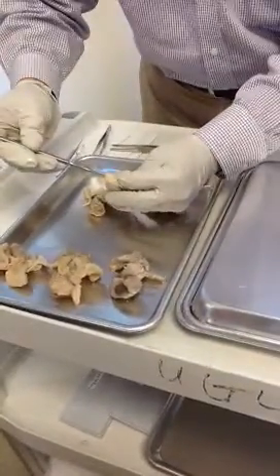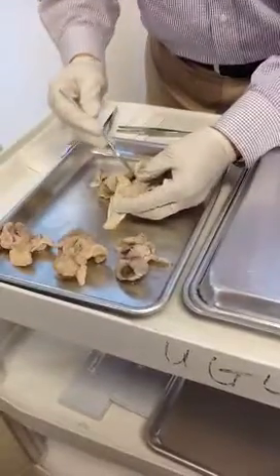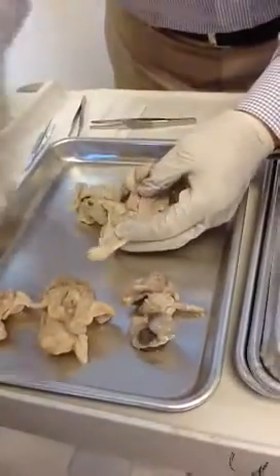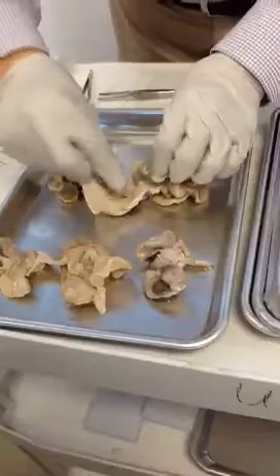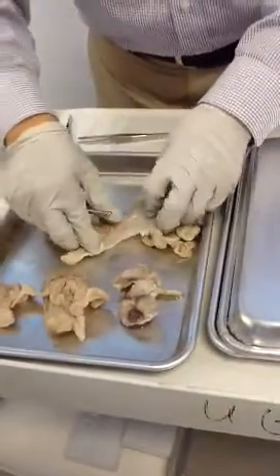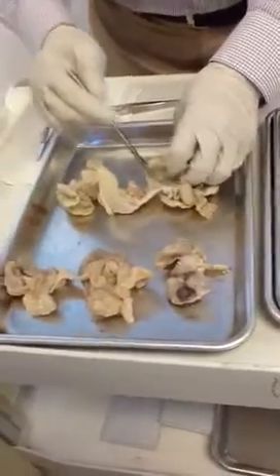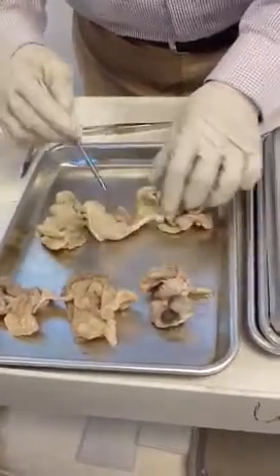They open here is the cervix. And then that is the cervix, and then it goes to the vagina. And here is a Y-shaped structure. As you keep going up, you see that here is the uterine horn, and here should be a broad ligament. Here's uterine horn — it's broad ligament.